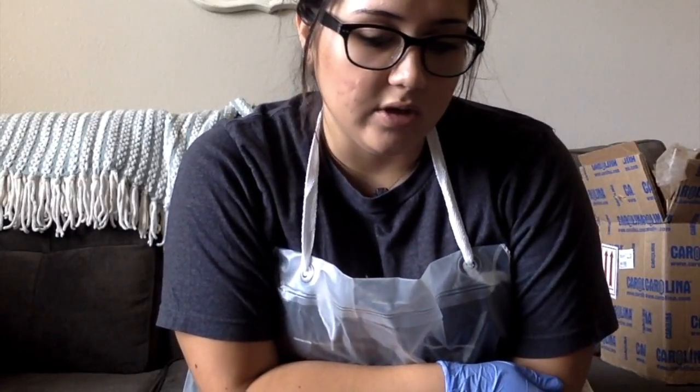This is Gabby Delapiani, and I am performing Lab 8 for Chem 1412, the determination of Ksp of calcium hydroxide. For this lab, it's a lot like Lab 7, and I think Lab 6 too, where we're checking for color change and whatnot. So we're using a lot of the same background. For Activity 1, I'll be doing titration of saturated calcium hydroxide with hydrochloric acid.